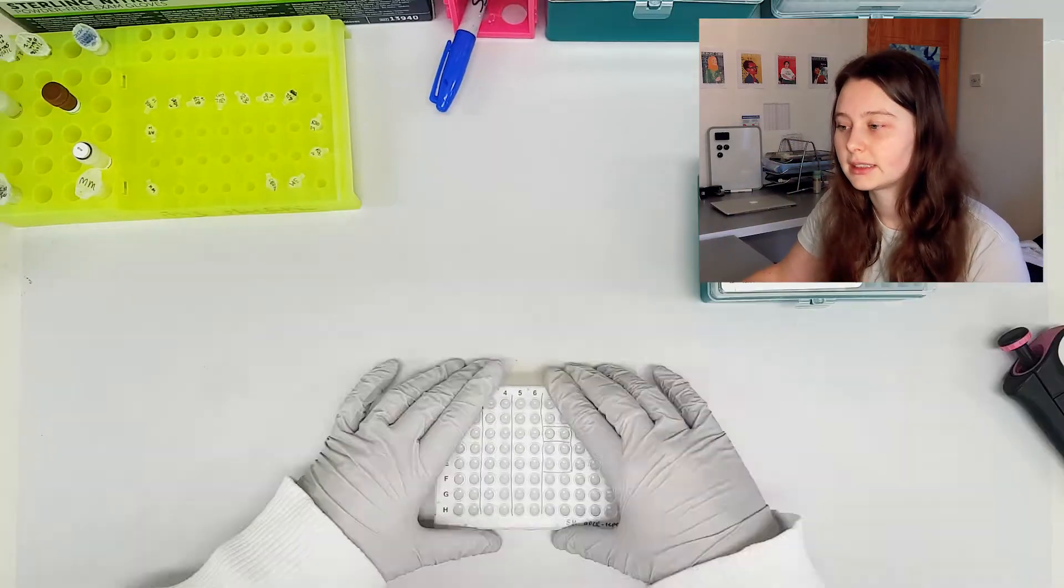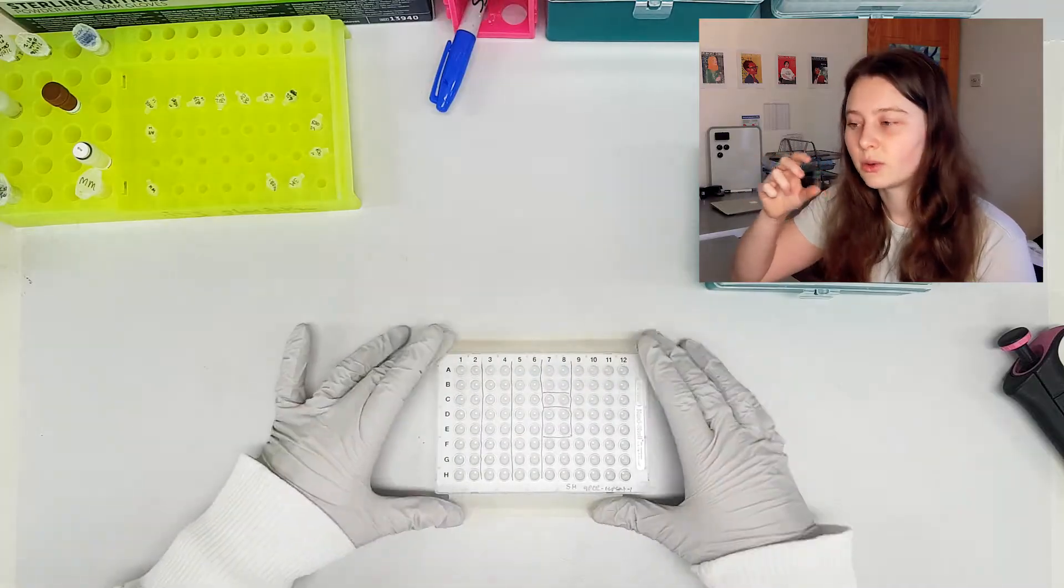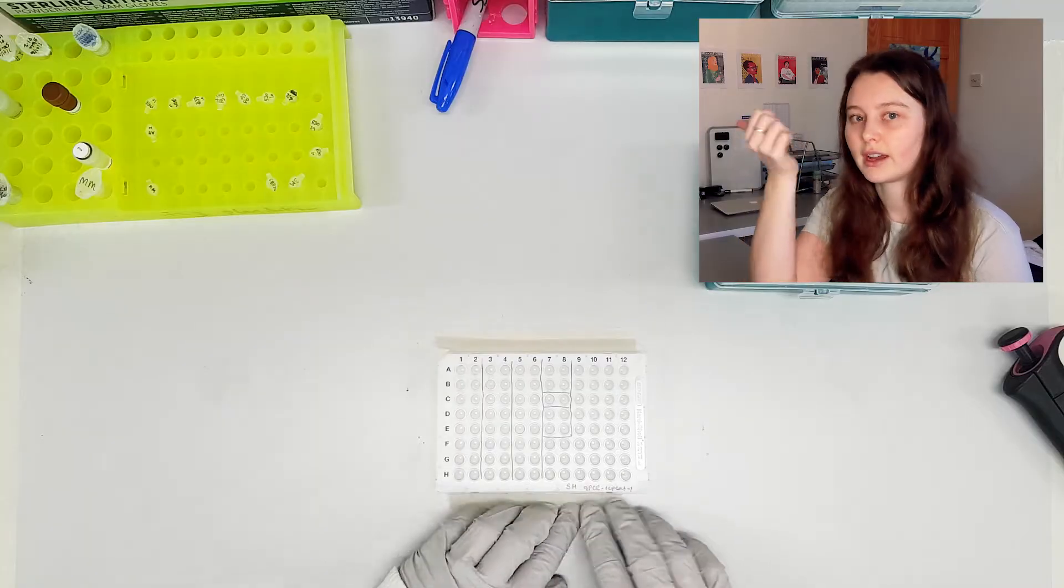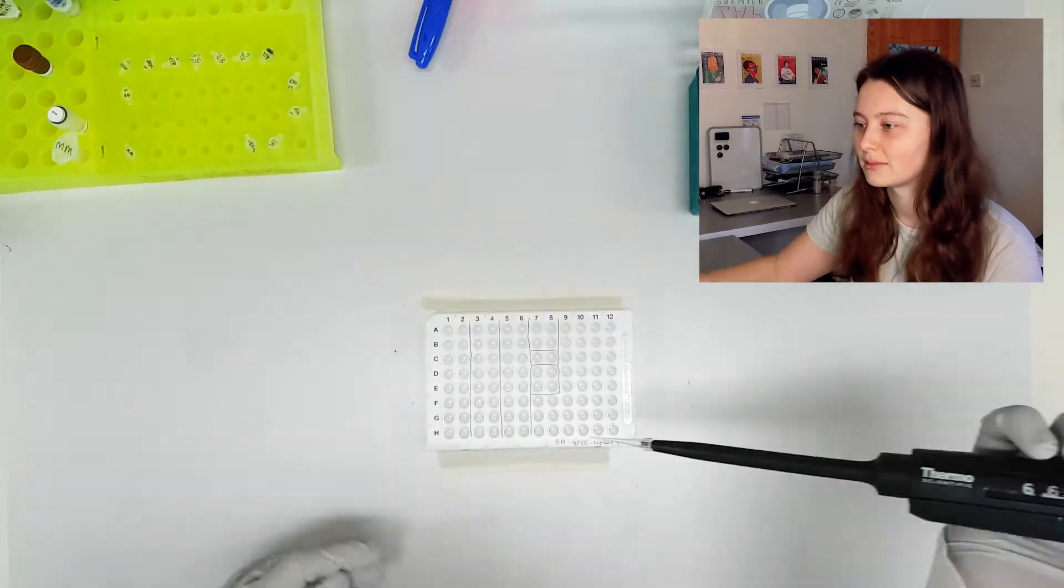I like to tape these plates down. These particular plates are quite light and skittery, so as you're pipetting into the plate it can start moving around a bit.